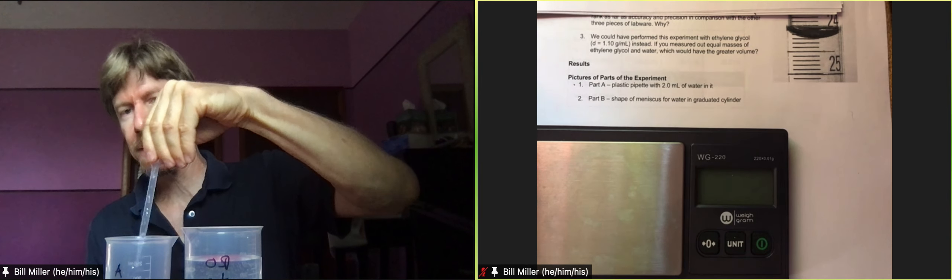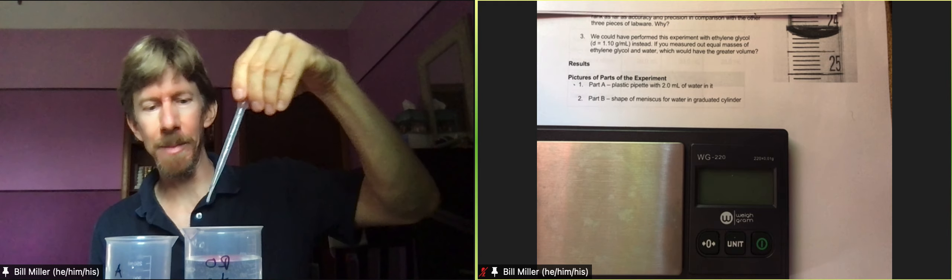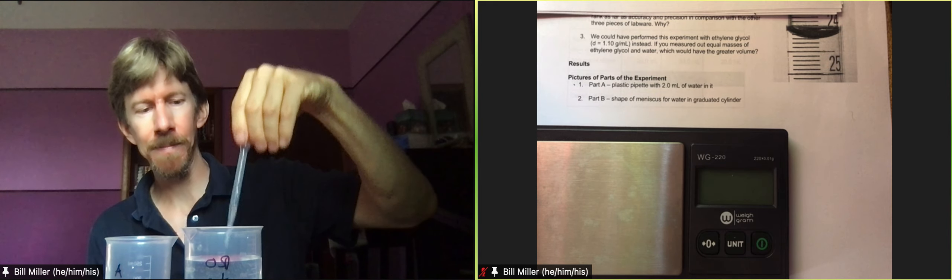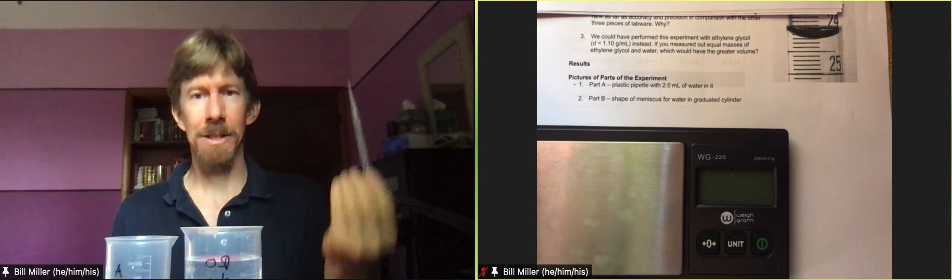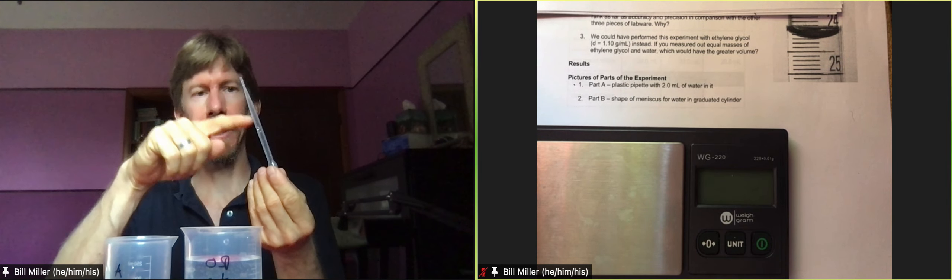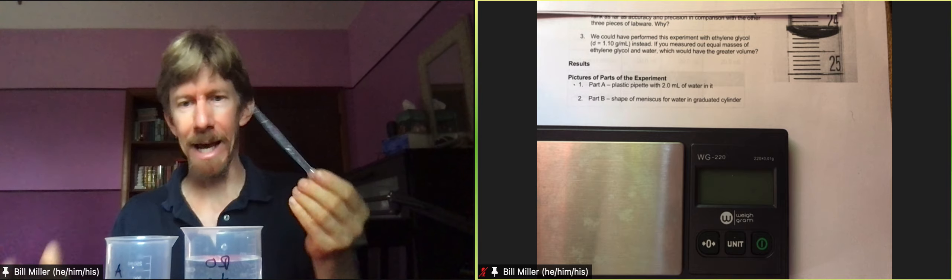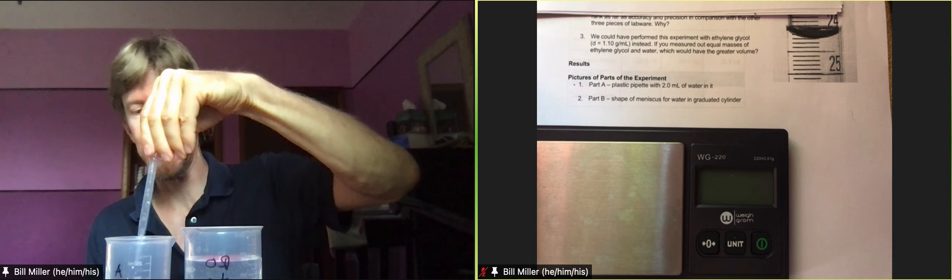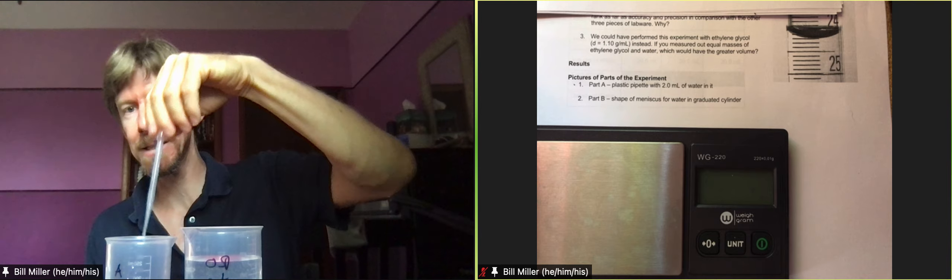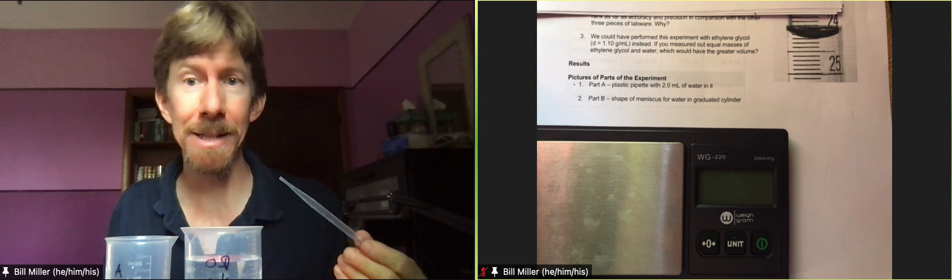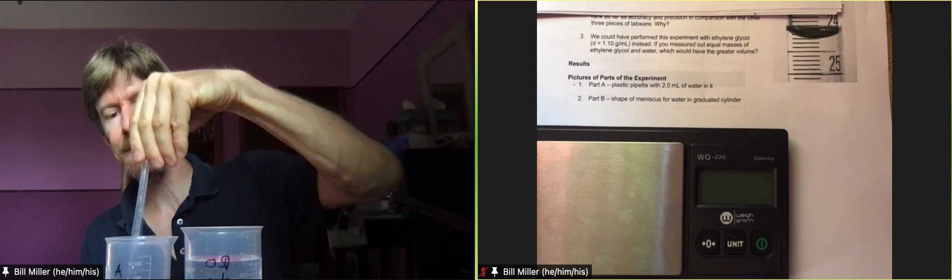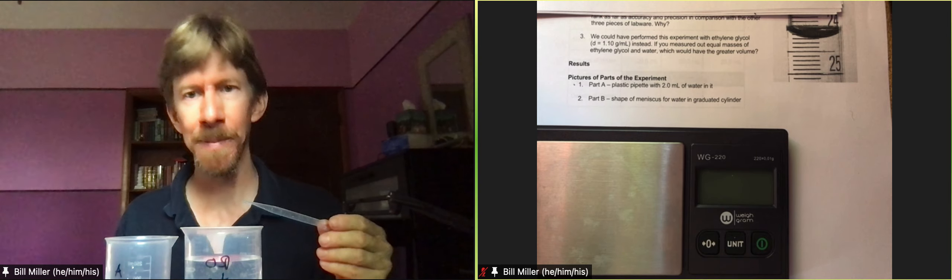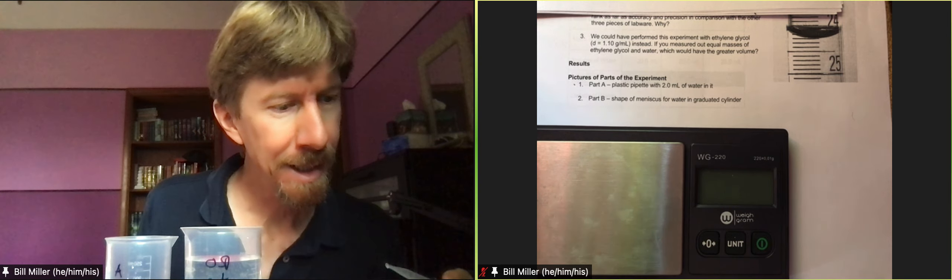Because we don't know what's inside this there could be residue from the manufacturing process. We want whatever solution is in here to take everything out that was in there before. Maybe somebody else used this pipette, just in case because we're always making sure that we're getting exactly the chemicals that we want. So you saw me do that three times. That is always what conditioning means, conditioning means rinse three times with a small amount.